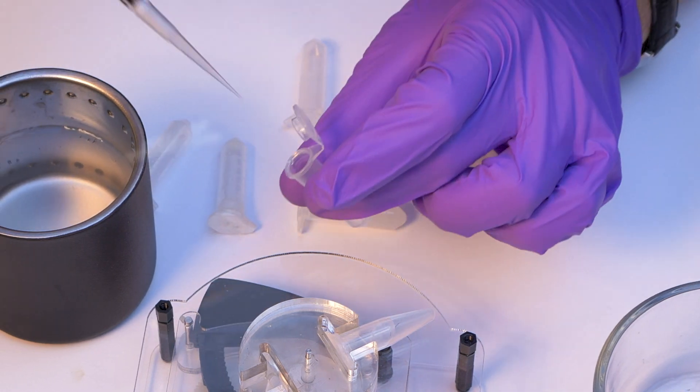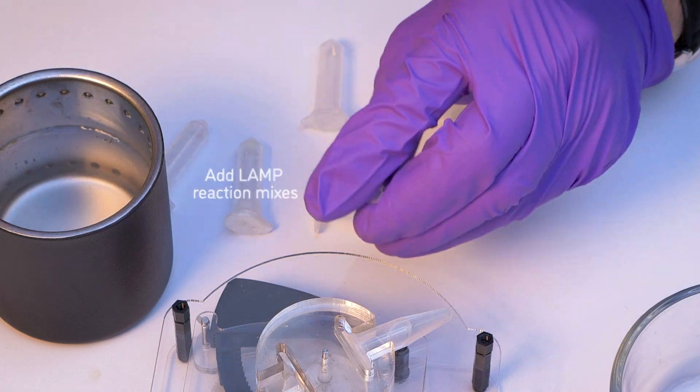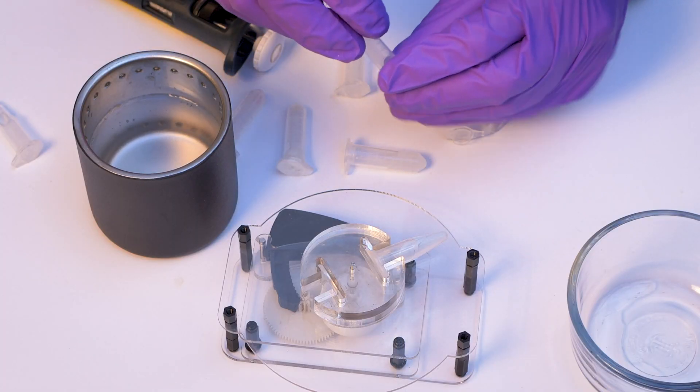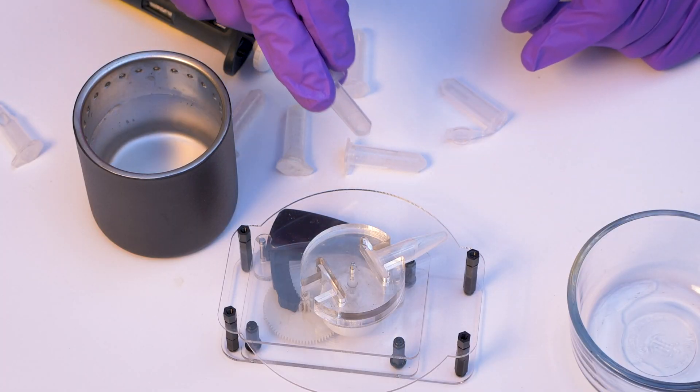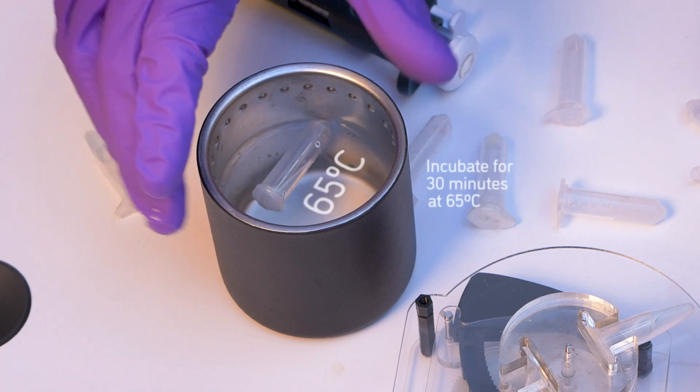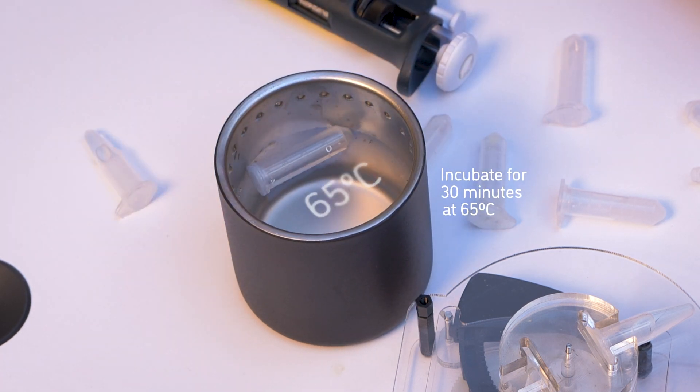So if we want to do the reaction right away, we'll just add these reaction mixes to this exact same tube and proceed with the reaction. So then for the reaction, we'll incubate this tube at 65 degrees Celsius for 30 minutes.